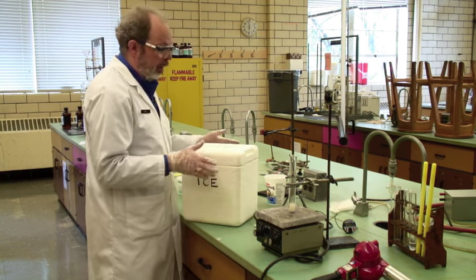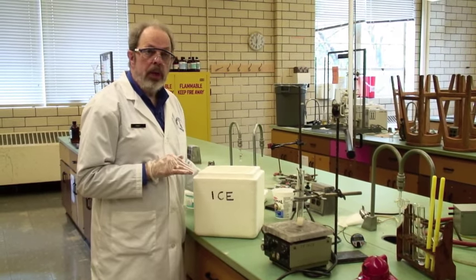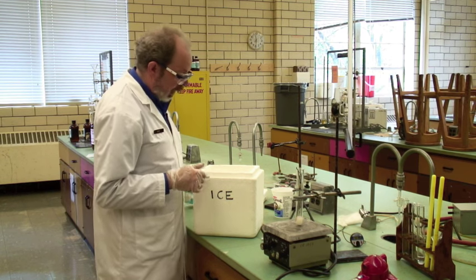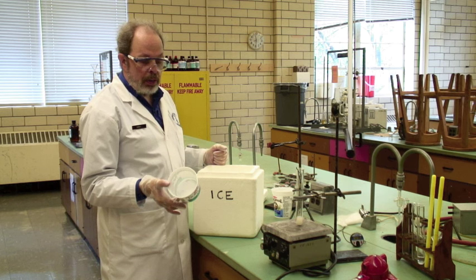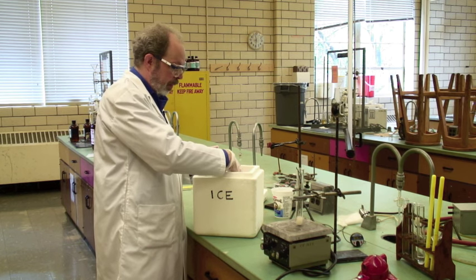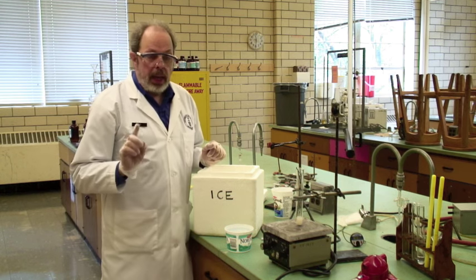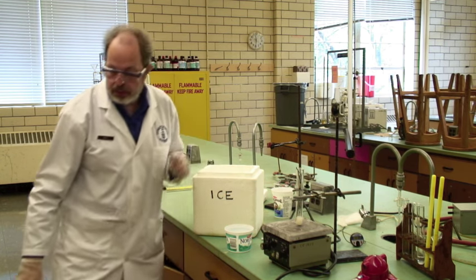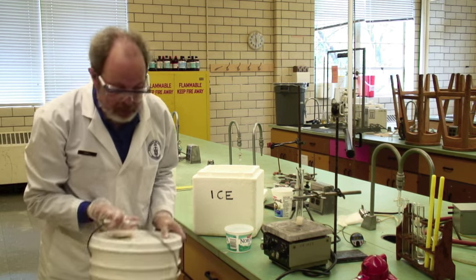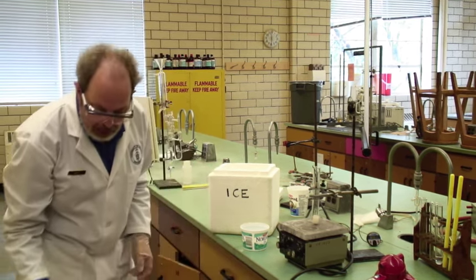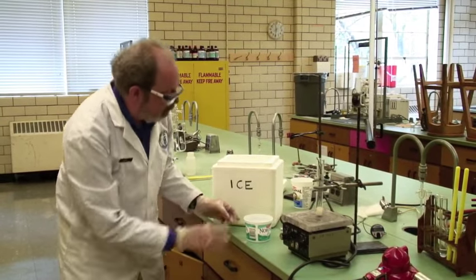There is ice available. It comes in a clearly labeled container. You aren't the only person using the container. You aren't the only person using the ice today, so look around. The kinetics people use ice as well. You'll want something about this size, about half full of ice. And into this you put some water and rock salt. And we have a large bucket of rock salt here, which lives nearby.